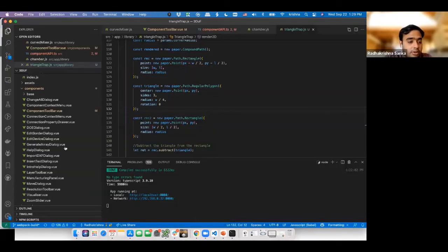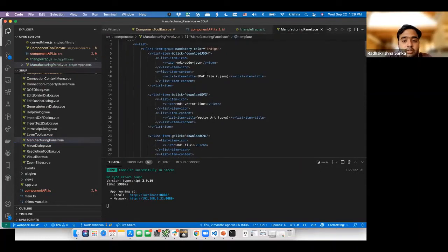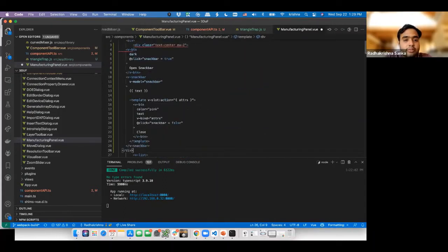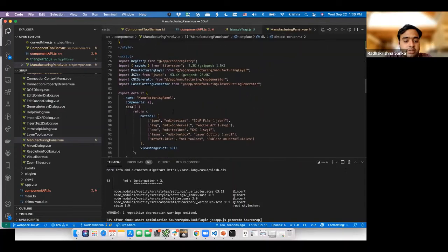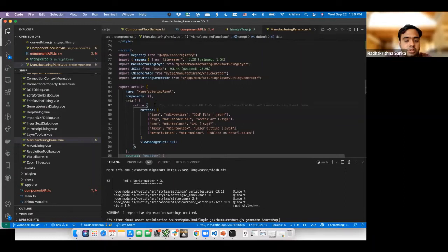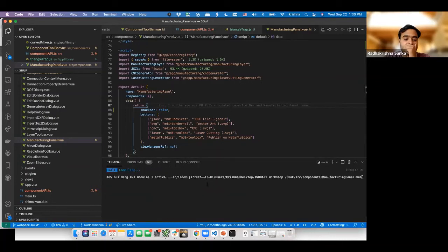So I'm going to go to my code, go to my manufacturing panel, and look for the file which does that. So here's the item which does that. Instead of doing anything crazy, I'm just going to drop the thing here and let it sort itself out. Now that the model's set, let's see if it cries about anything. Okay, I'm going to set snack bar to false, because you need to set it to false for it to work. So we'll wait for this to compile.